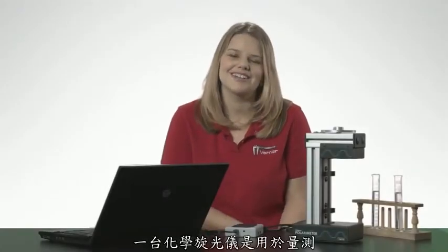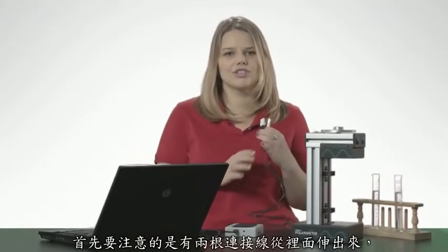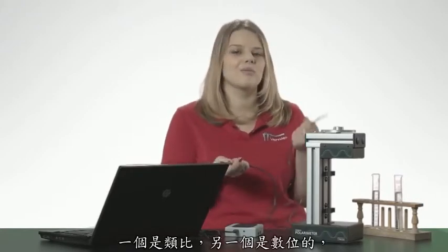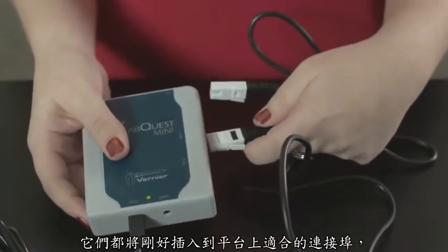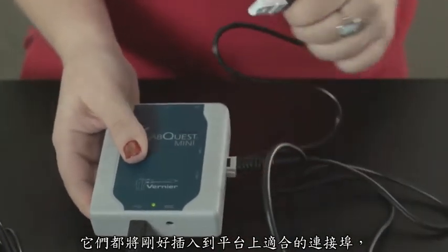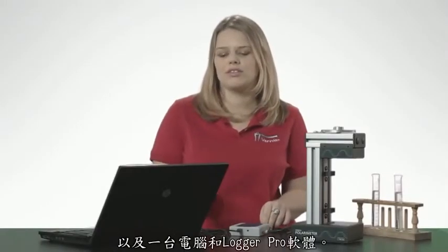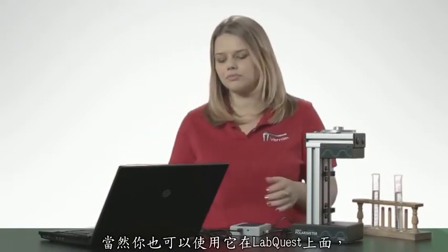A chemical polarimeter is a device for measuring stereochemistry of molecules, and today I'm going to give you a brief introduction on how to use the polarimeter. First thing to note is that it has two cables coming out of it. One is an analog and one is a digital. They will only fit into specific ports on your interface. Today I'm using the LabQuest Mini with a computer and Logger Pro, but you can also use it with LabQuest.